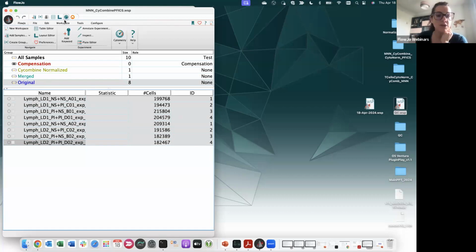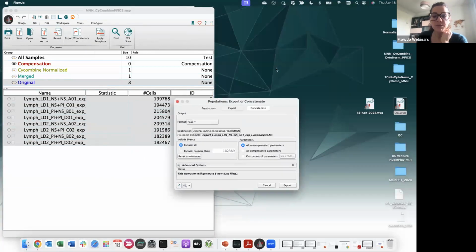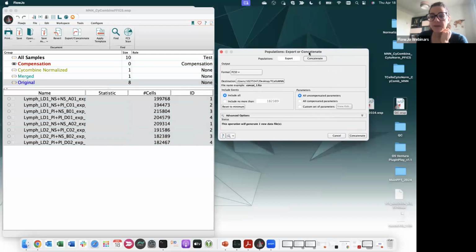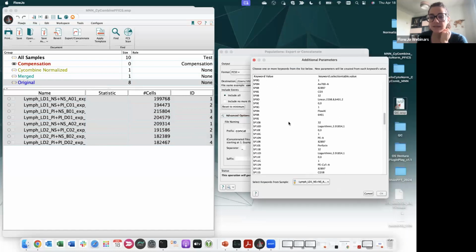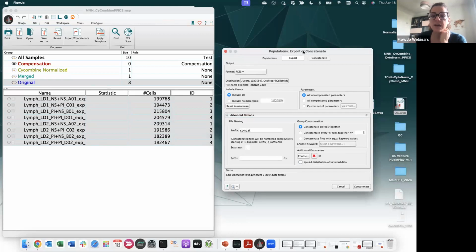So if you want to do a concatenated file in FlowJo, you will select all of your samples, go on your work on file, export concatenate population. Here you have the concatenate step, and then please do not forget to add as additional parameter the batch keyword that you used. So I used ID, which is right here, okay? Do not spread the distribution of the keyword data, and then you can concatenate.